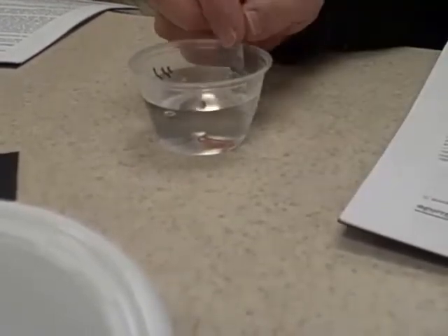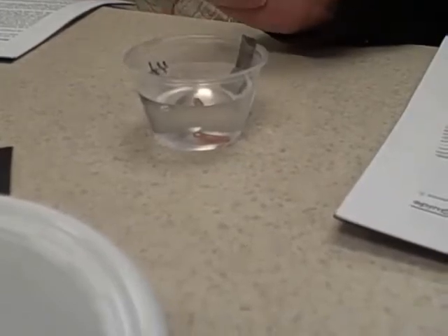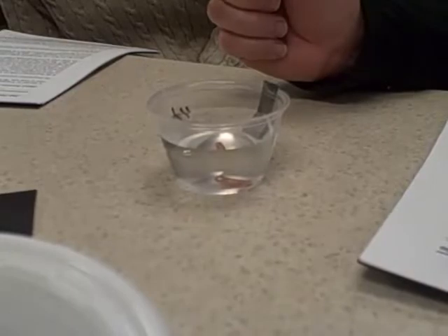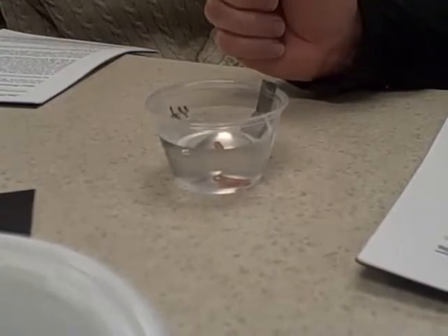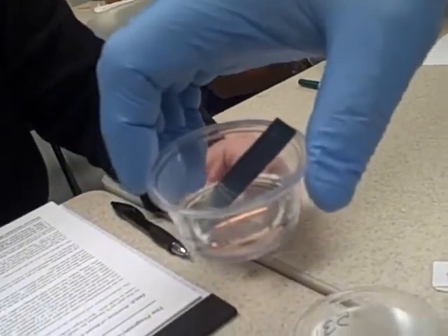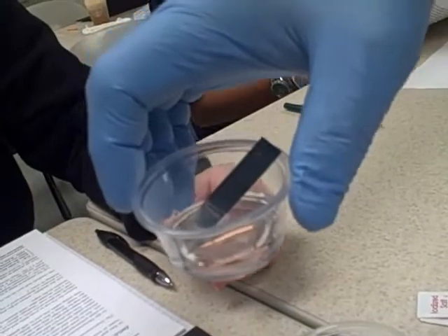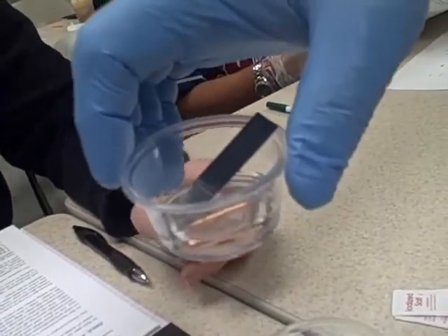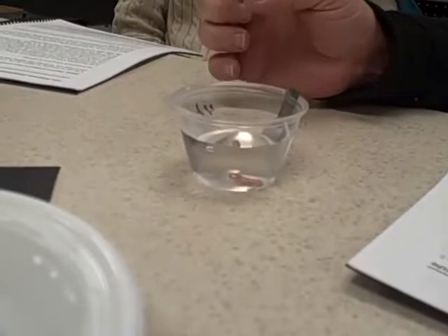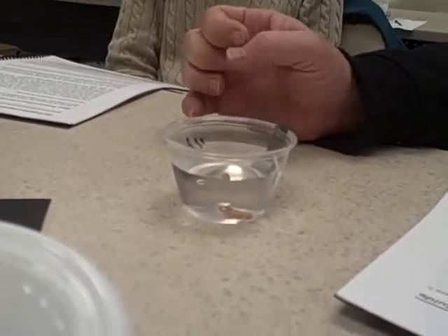Okay, at this point, I don't see anything. Mike, you see anything here? Well, you guys did the same thing. Okay. Well, they're students. They're supposed to be doing that. Students aren't supposed to be doing it yet. The students are putting the metals in the hydrochloric acid already. No, that's water. Is it water? It's water. 41 is water? Yeah.